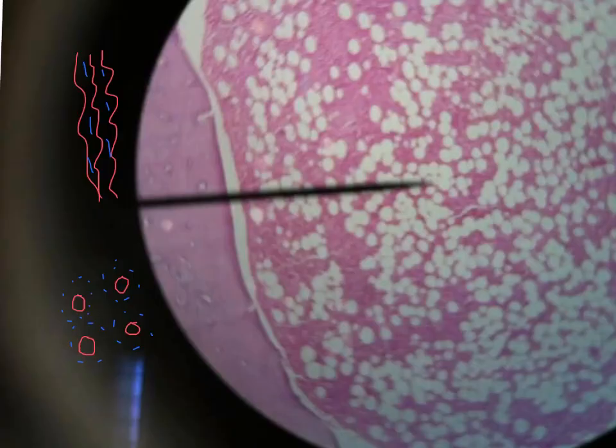Under the microscope, you will see the bone marrow very evident in the cavity and characterized by the presence of many fat cells, as it is a yellow bone marrow, in addition to the hemopoietic tissue in between. Most important is looking for the wall of the bone, and this bone will be formed of the Haversian canals. Here, these rounded structures are the Haversian blood vessels, and they are surrounded by the nuclei of the osteocytes, 1 or 2 circles.